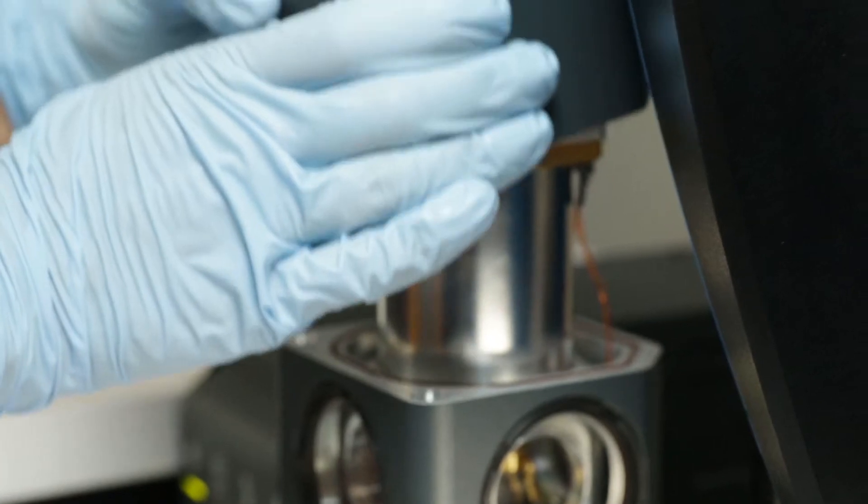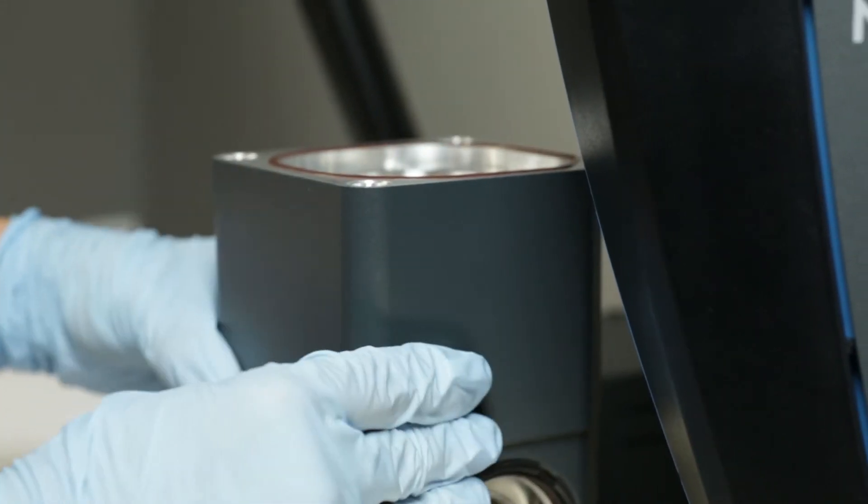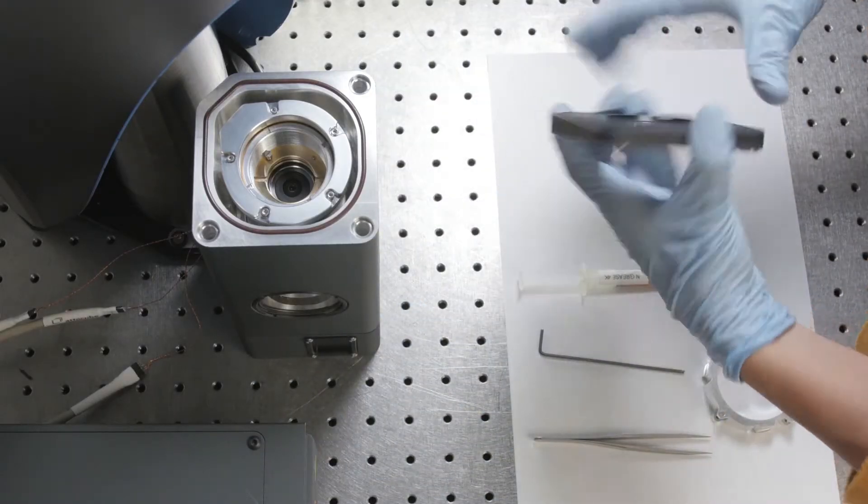The O-ring goes on top, and then we'll put the lid on.